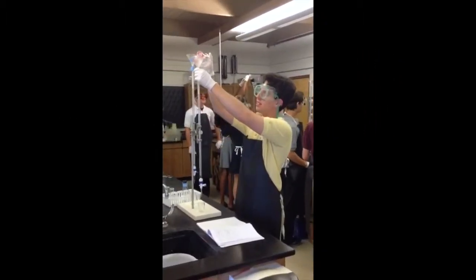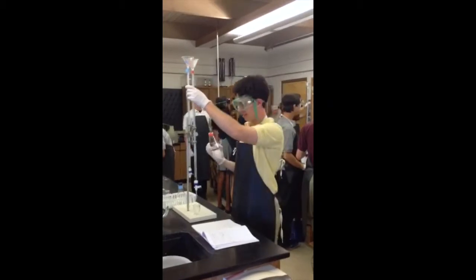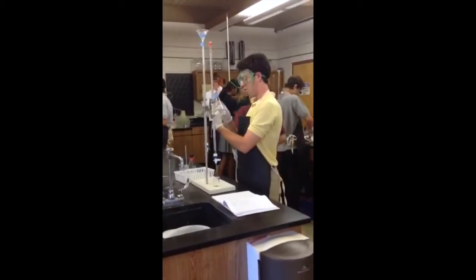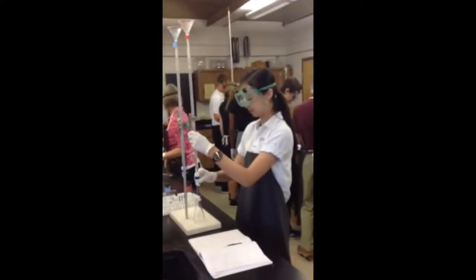Two burettes were set up, one for the acid and the other for the base. The acid burette was cleaned by rinsing the burette 3 times with the acid being used. The same thing was also done to the base burette. The acid burette was then filled to a point above the 0 milliliter calibration mark with the acid of unknown concentration. Some acid was then released to get rid of any air bubbles, and it also lowered the volume to the calibrated portion of the burette. The volume of the acid in the burette was recorded as the initial volume.